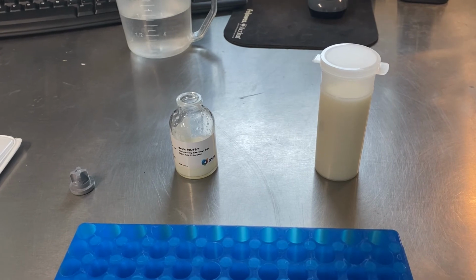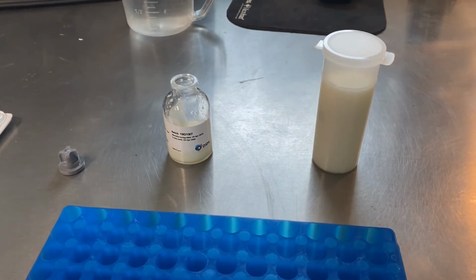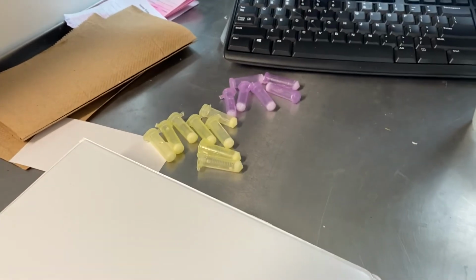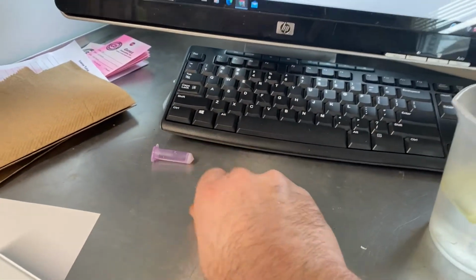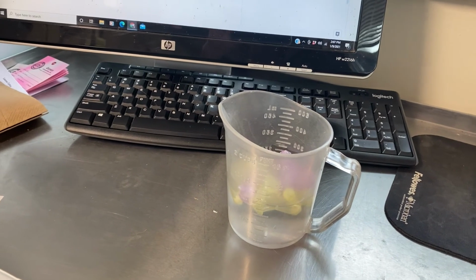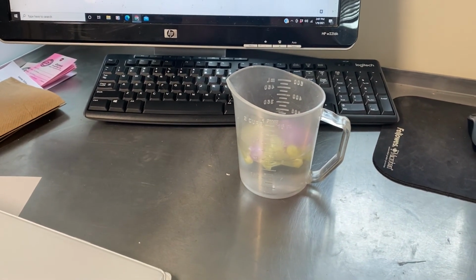So if you know you're not going to make any more samples, whatever you have left can just be discarded. And then any of the remaining control vials from the last batch, I just take those, and we do try to reuse those. So I just take them and we throw them in the hot water or the warm water, thaw them back out if they still need to thaw, give them a good washing, and then put them away with the rest of the empty sample vials for future use. That's it.